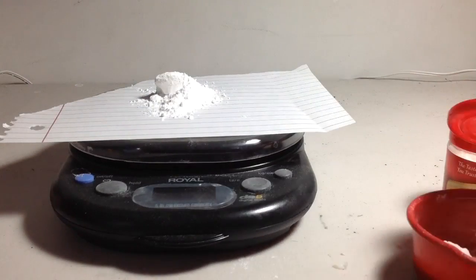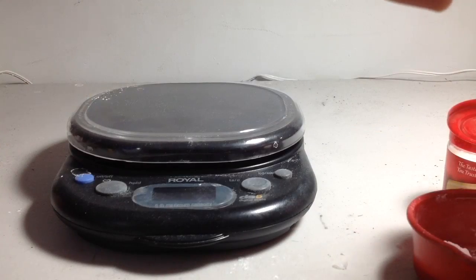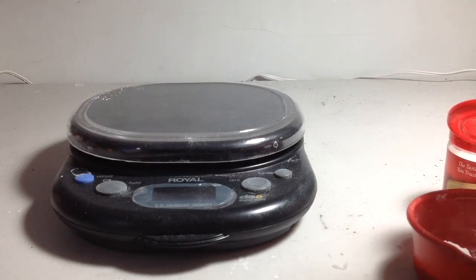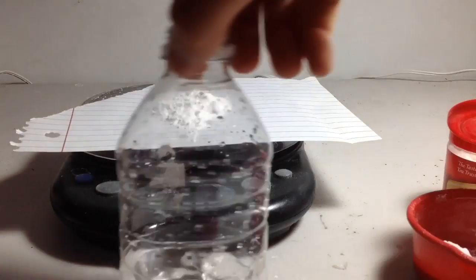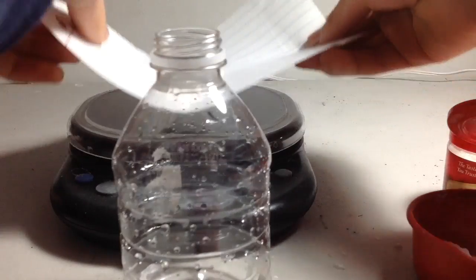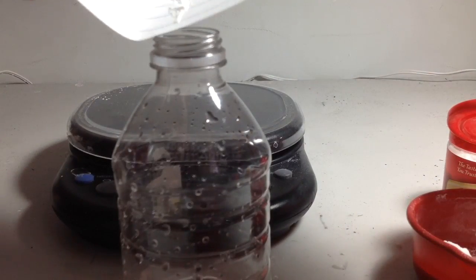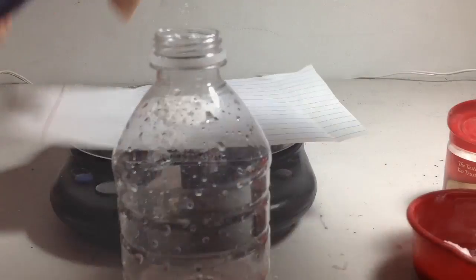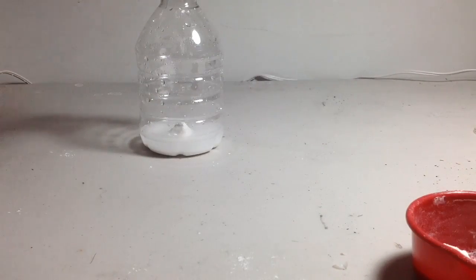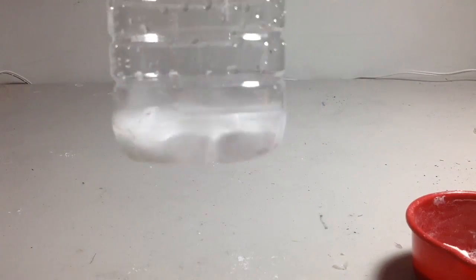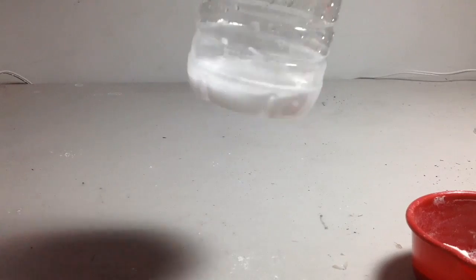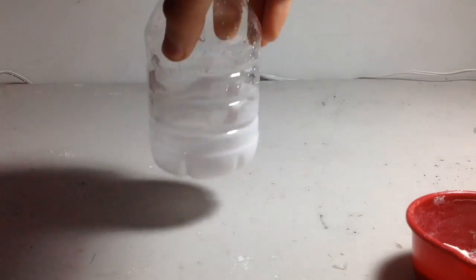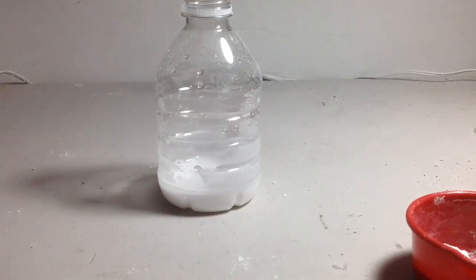That's 9 right there. Right now I'm putting it into the water. Okay, I'm back and I got the cream of tartar in, which is potassium bitartrate. I'm just going to shake it up and you see that it's not very soluble. But once we react it with the sodium carbonate, more and more should dissolve.